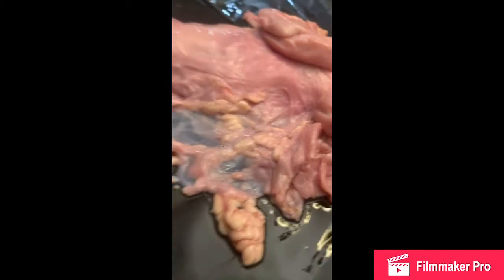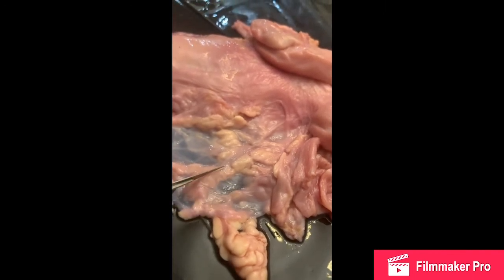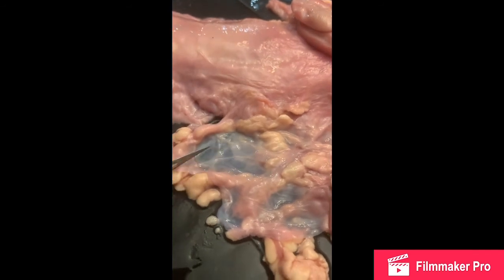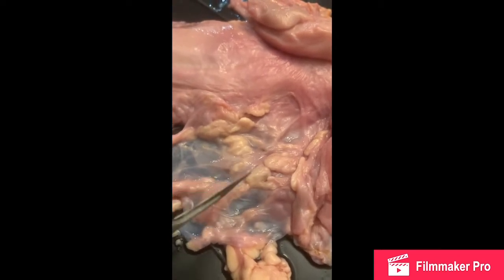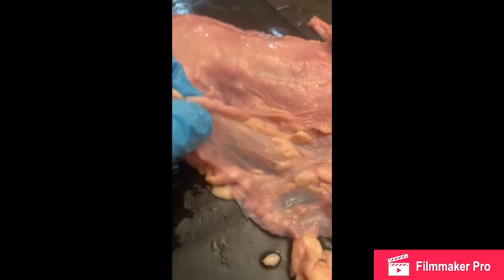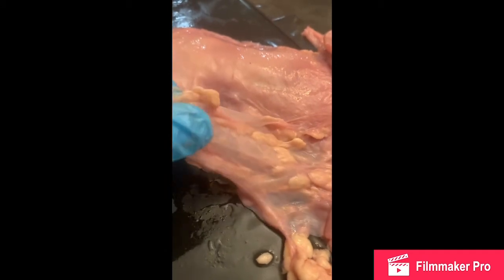Okay, next we're going to look at our oviduct, which is right here. This is going to be our infundibulum right here, and this is going to be the opening of our oviduct, and this is where the egg is going to be captured during the time of ovulation. You can see all the muscle that would contract in order to move it down to where it needs to go. In feeling the infundibulum, we can feel that it gets firmer about right here, whereas the rest of this is still very soft.